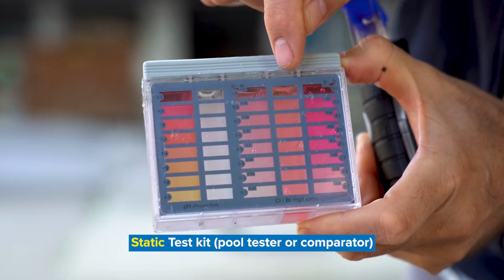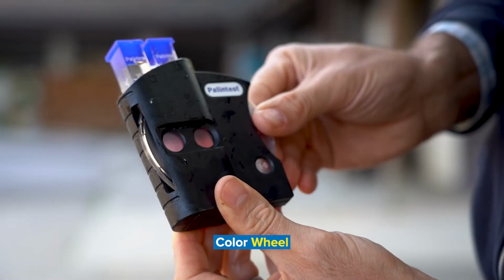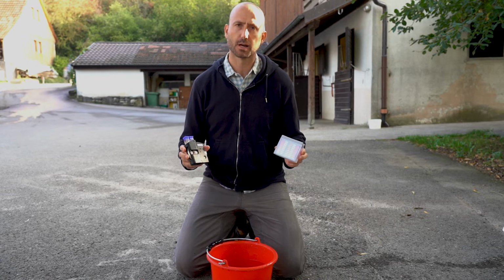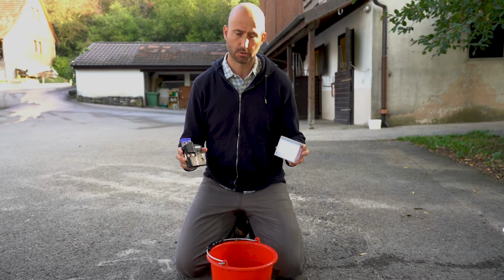Measuring FRC in the field is inexpensive and easy. The two most common methods are the static pool tester and color wheel. Both are colorimetric tests whereby a reagent is added to sample water to cause a color change. The most common reagent is DPD, which results in a pink to red color change. Each test kit will come with a reagent in tablet or powder form. Make sure you follow the manufacturer's instructions and use the appropriate reagent, as test methods may vary slightly and not all reagents are compatible.